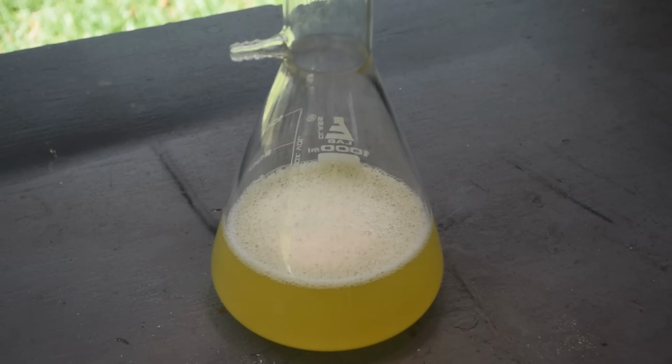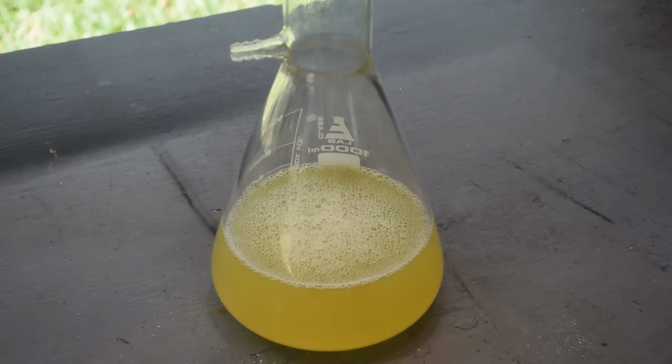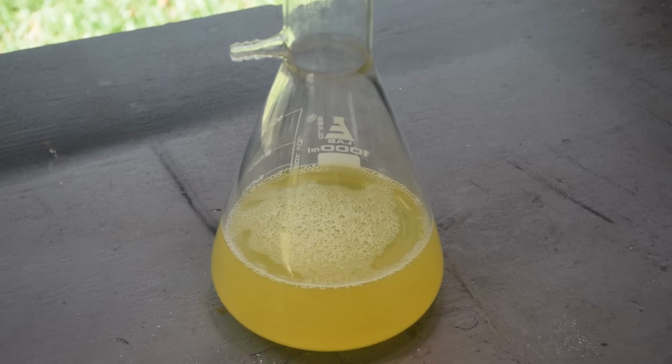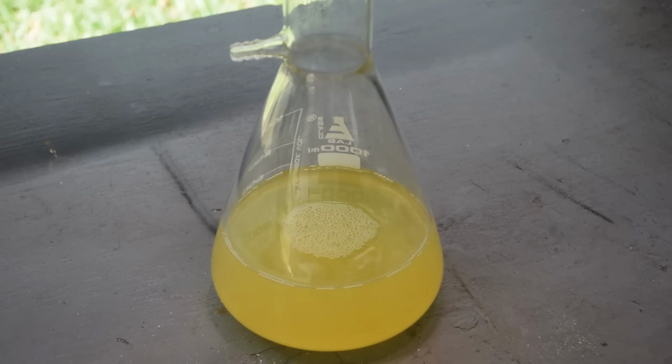All right, so the next time I play with palladium, I think I'm going to do it a little different. I think I'm going to go with my original instinct to put it in the oven and sublimate away the red salt into palladium sponge, or use DMG and then sublimate it away in the oven. So those are for next time.